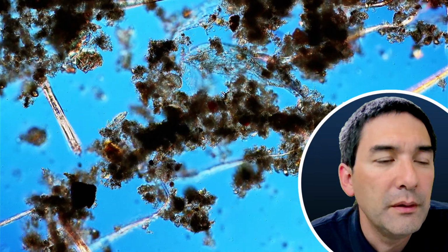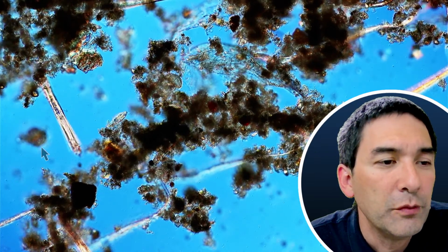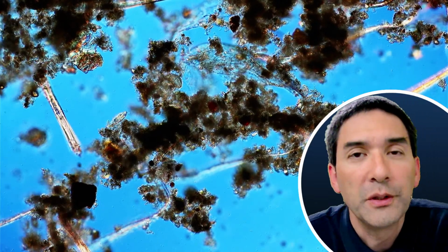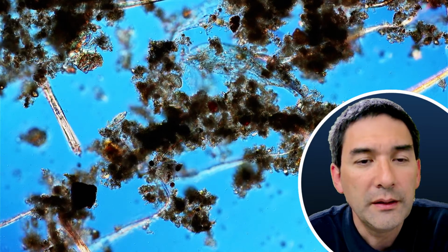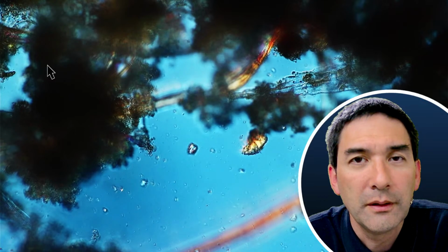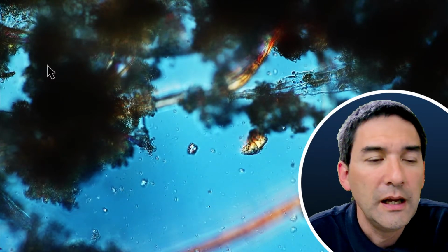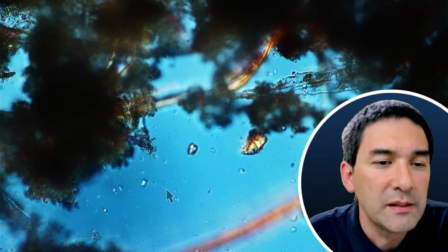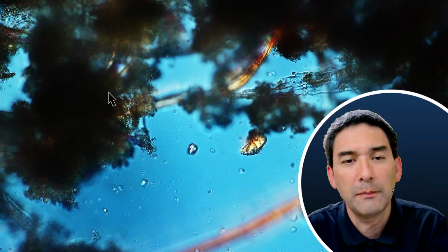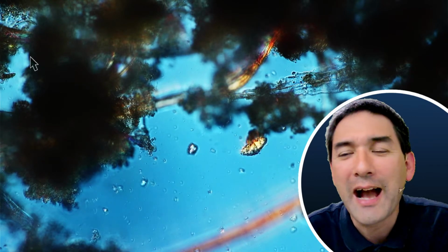But I've also made other time-lapse videos, for example, there's a little bit of movement here. I've also made others where there was a lot of movement going on. So I recommend that you use this a little bit as a check to see if there are indeed moving organisms in there. And those particles that move here, that's most likely Brownian motion. So this specimen is in that sense not very active.